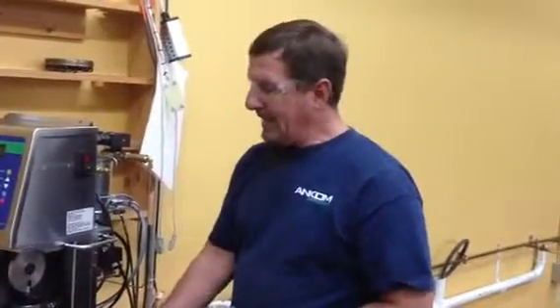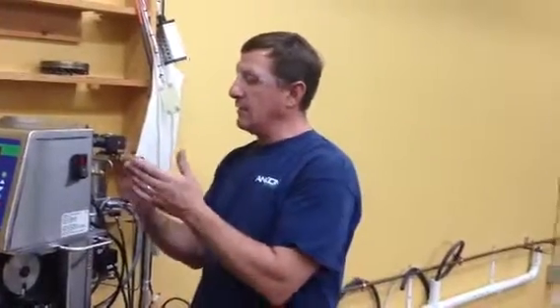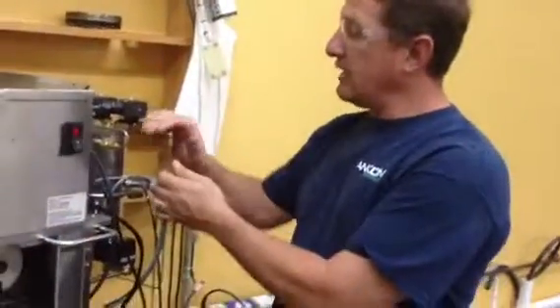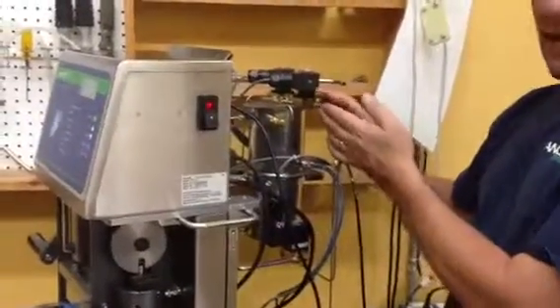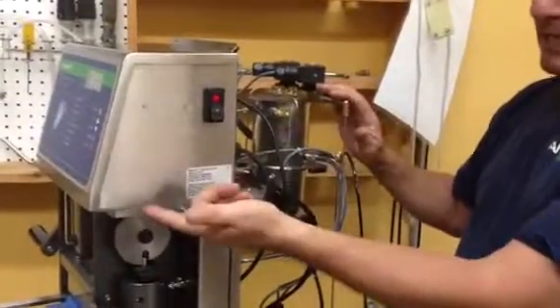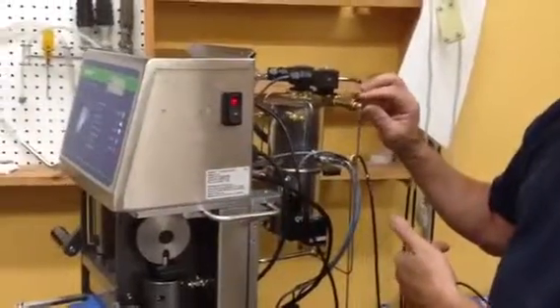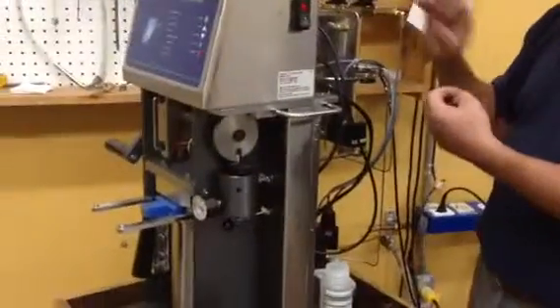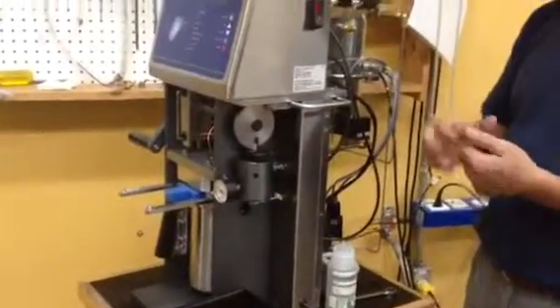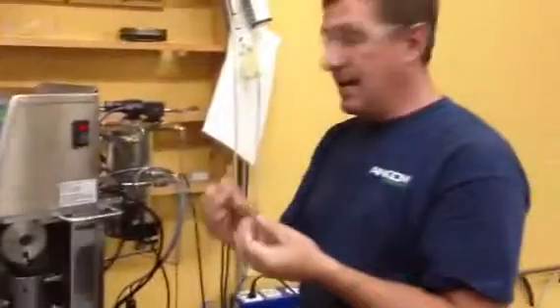Another way you can check without bubble solution is feel these tubes and these fittings in the valves. If they're hot during a run, that means vapor's getting by that section. Right now these are nice and cool, I can touch them. If I opened up this Q6 valve, this would get hot and you wouldn't be able to touch it because it's taking the 90 degrees C ether out of the vessel and through that valve. So it's continuously pumping hot ether through there. So that's an indication of a leak, is if something's getting hot.